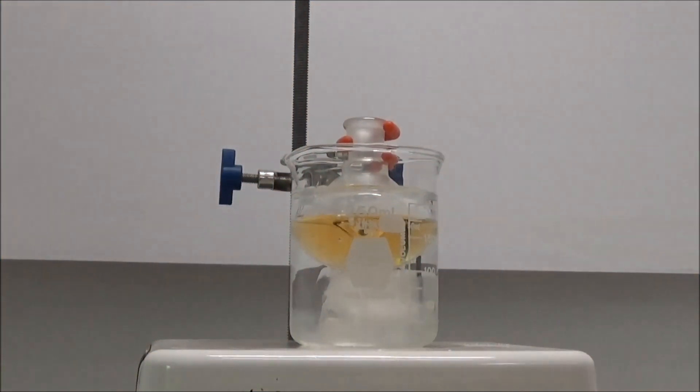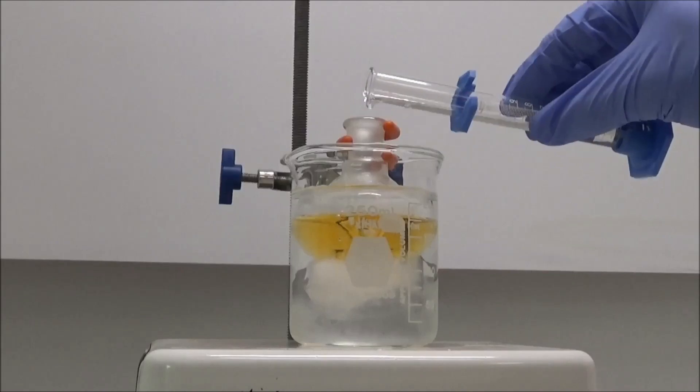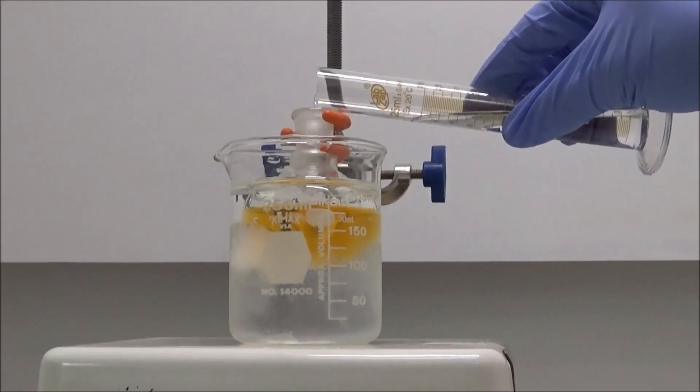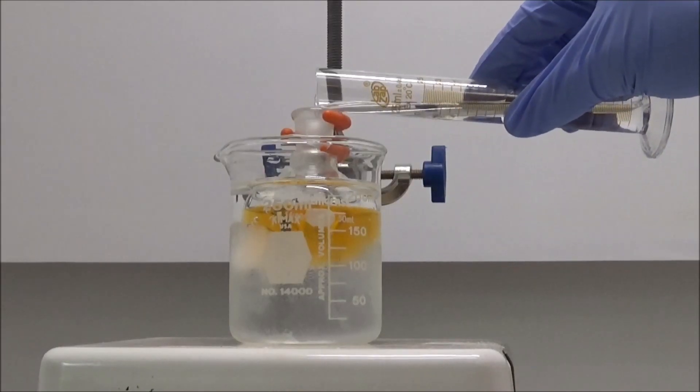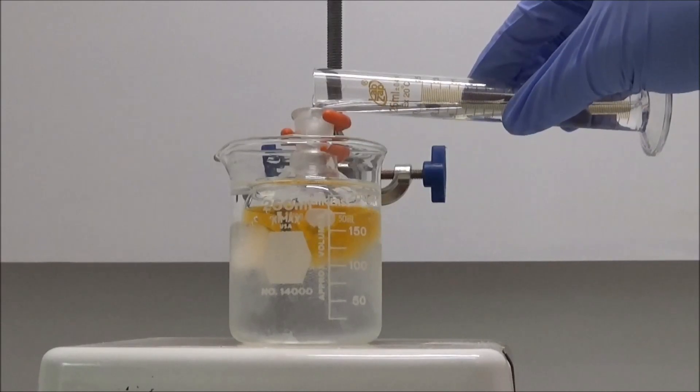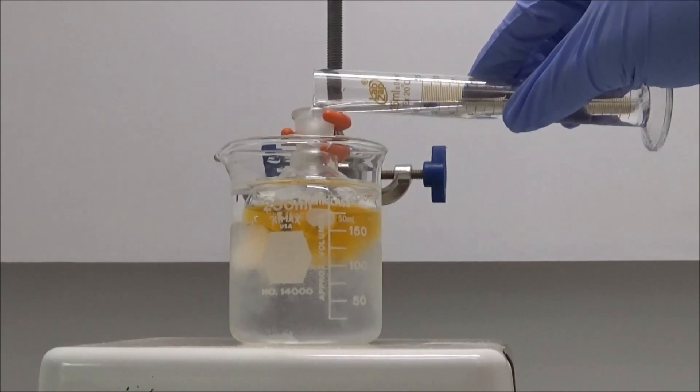To keep the mixture cool, I placed the flask in an ice bath. After this, I poured in the n-butanol. This doesn't need to be kept cold, but I just left it in the ice bath while I did this.